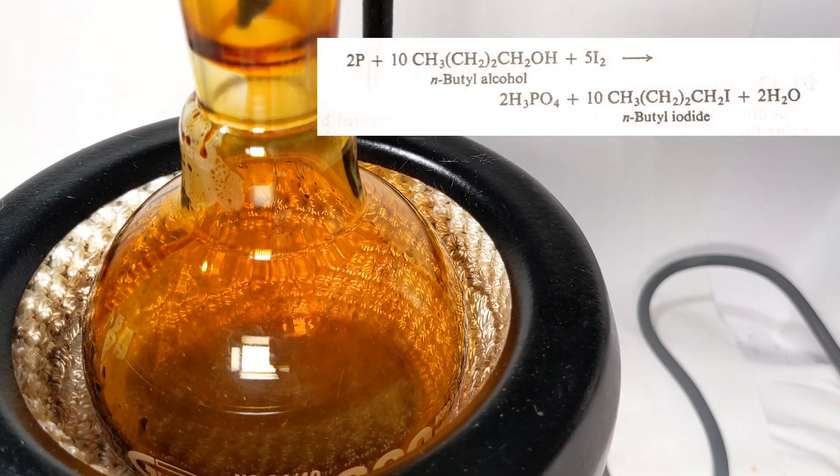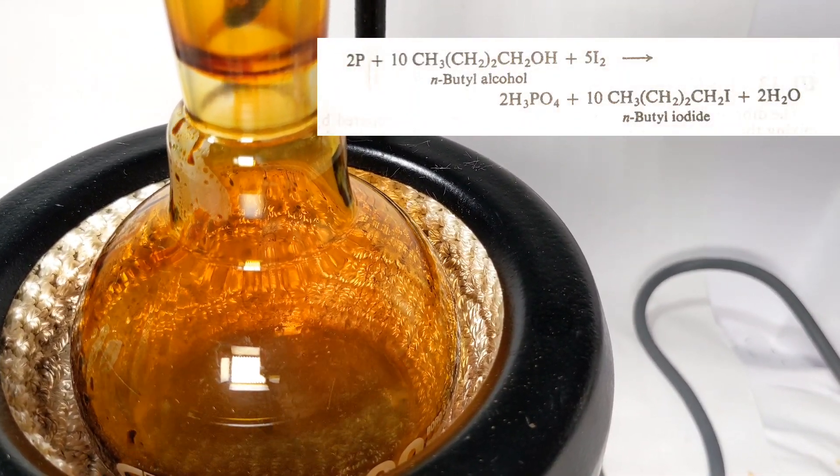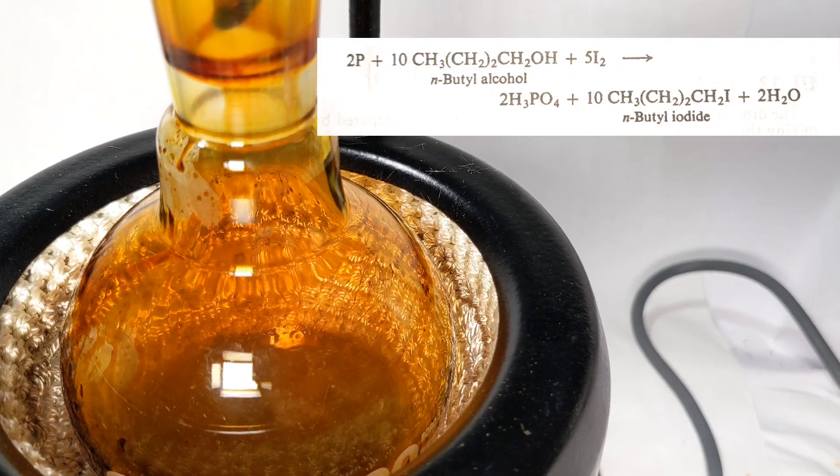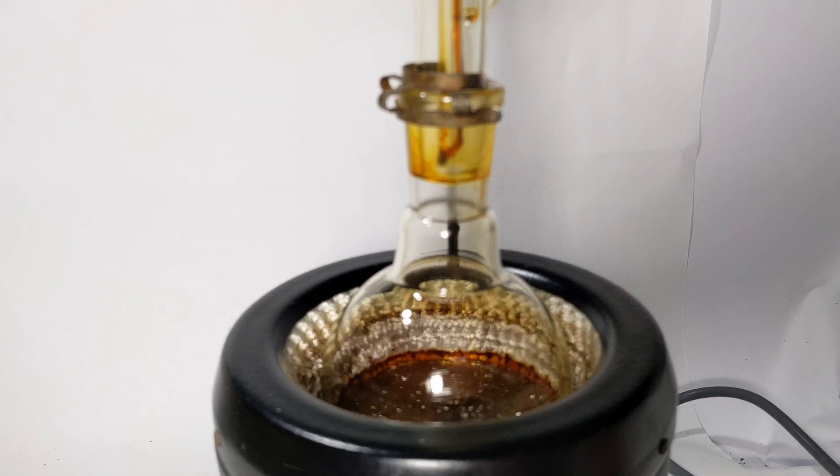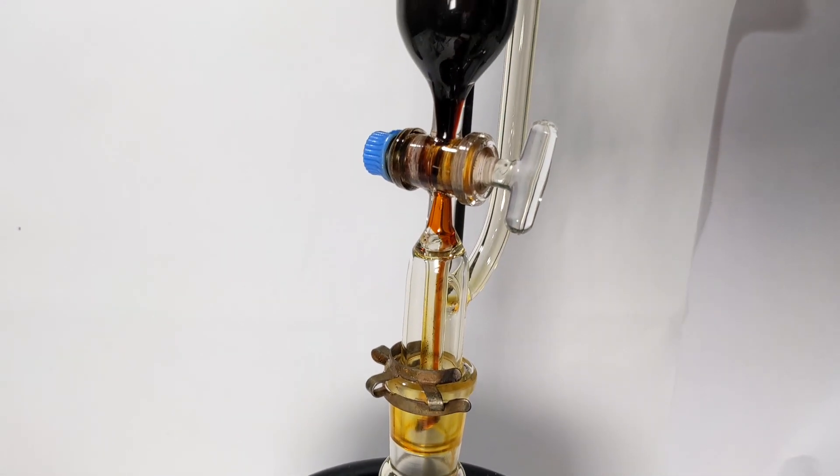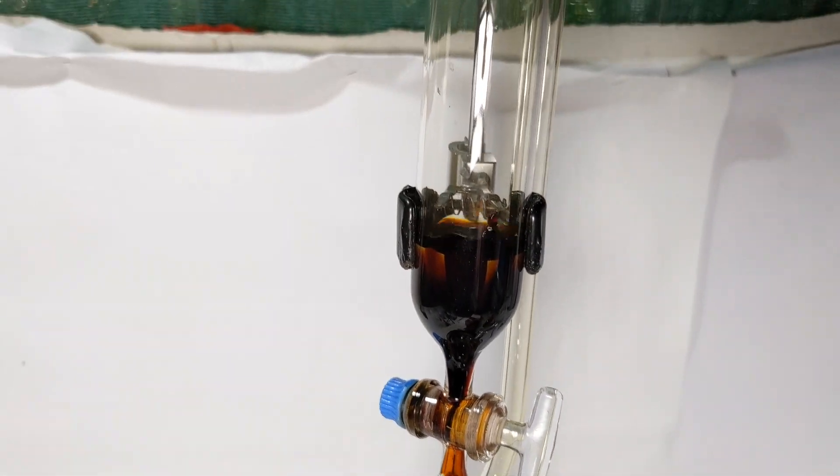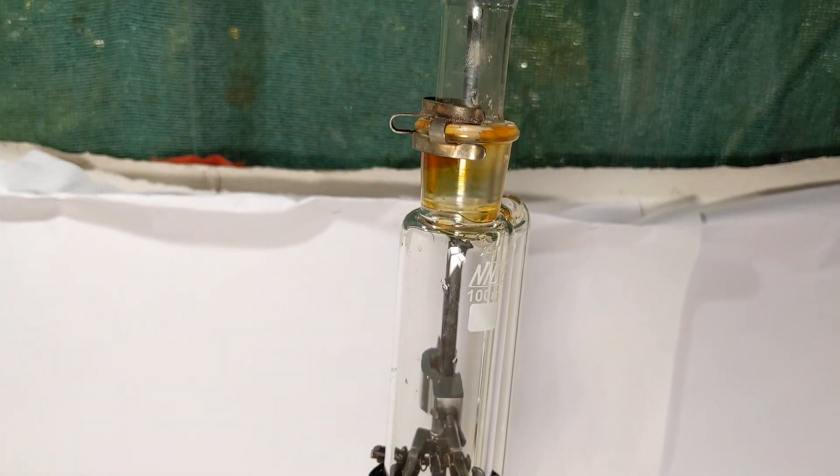What's happening here is the formation of n-butyl iodide by the following reaction. This mechanism was kept running until all the iodine gets used up.